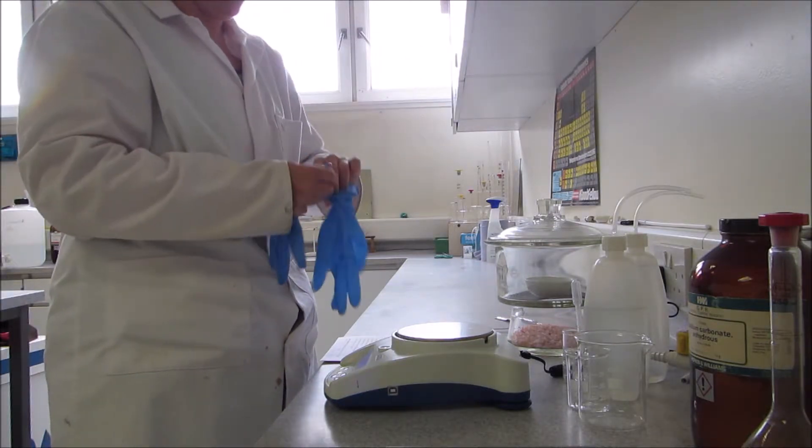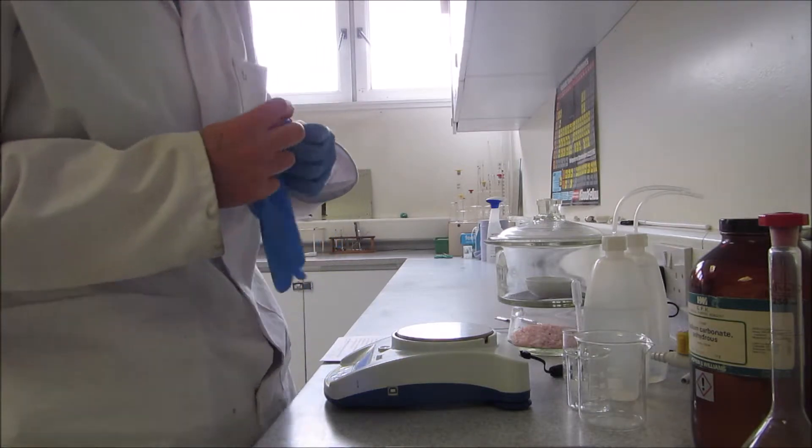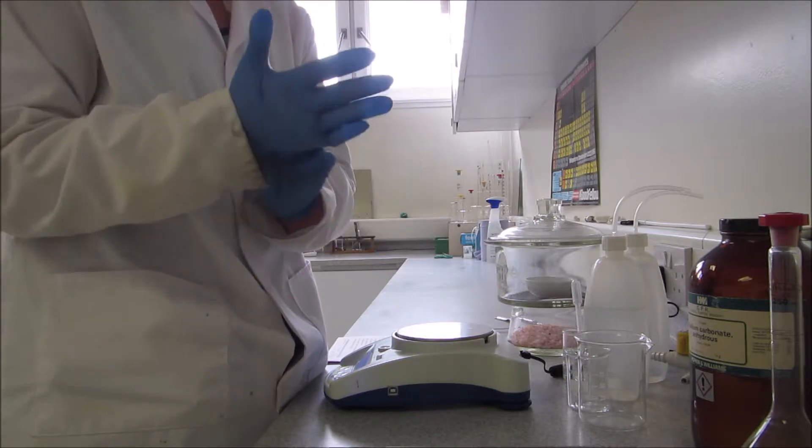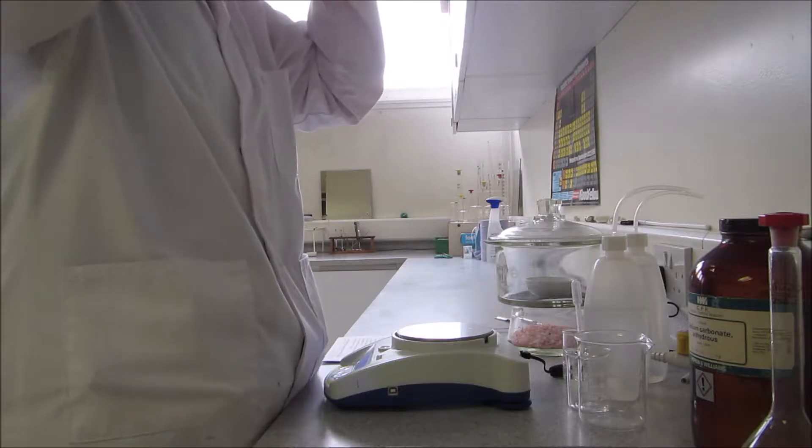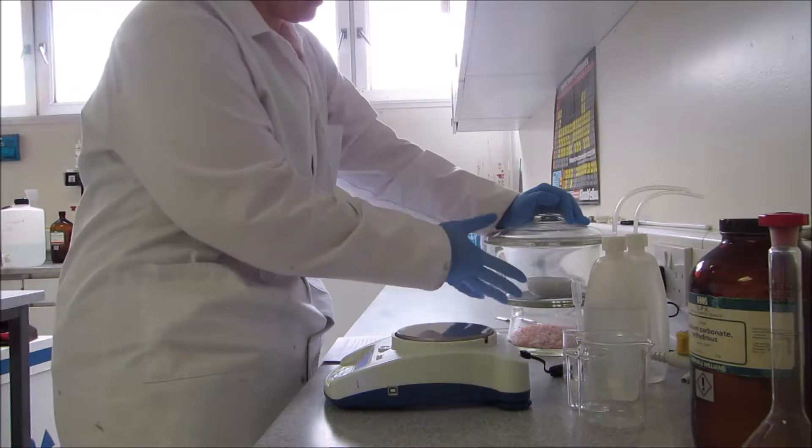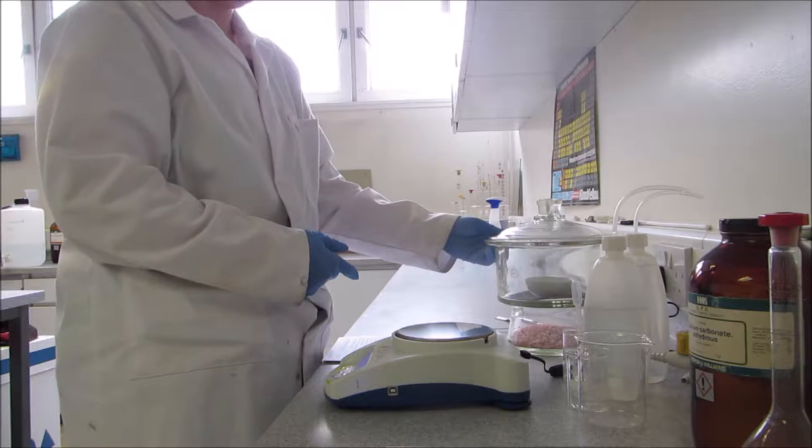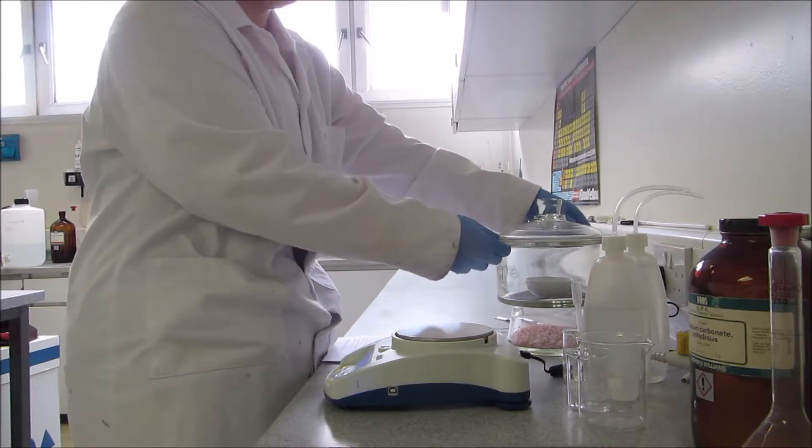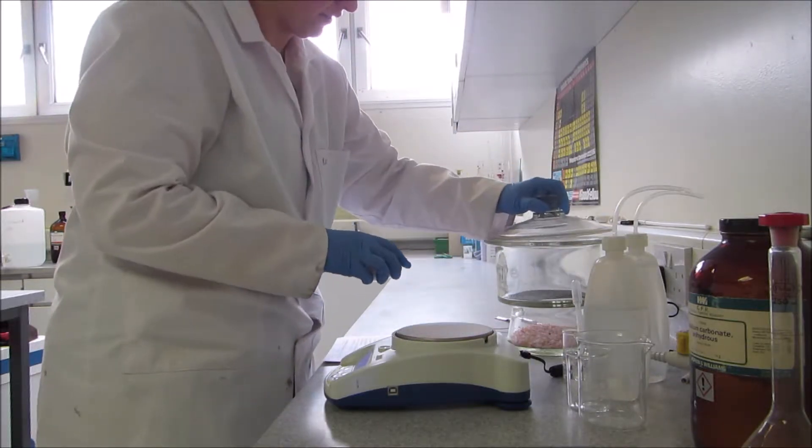This is anhydrous, which means that the salt solution itself doesn't actually contain any water molecules. However, over time the powder can absorb water from the atmosphere, and so before you make up any standard solution you need to weigh some of it out into an evaporating dish and leave it in an oven. This will completely dry the salt solution. Once dry you can put it inside the desiccator. So I'll just lift out my salt solution.